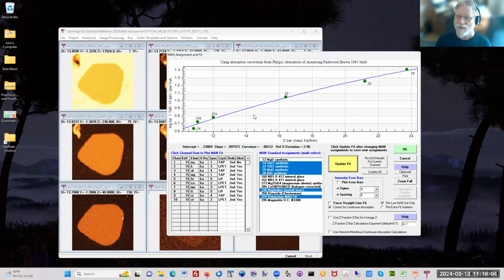So the good news is that you don't need to know if it's an interference or a contamination. It will lie above the trend, which is why you want to do 3, 4, 5, 6, or whatever points on your standards. The good news is that if you measure the intensities on your standards as primary standards, you can also use those same measurements as intensities for the mean atomic number background curve and for the interference correction for that matter. So you don't need to actually make any extra measurements in general unless it's an unusual case. But this takes a few minutes as part of your normal standardization. And then once you've done this, you never have to measure your backgrounds again for your unknowns. So that's kind of convenient.